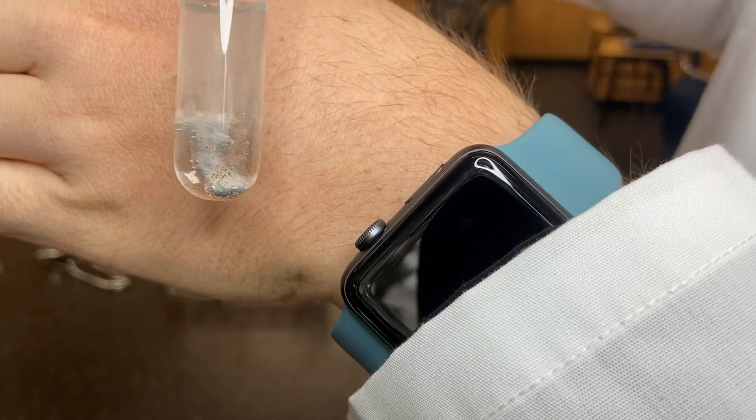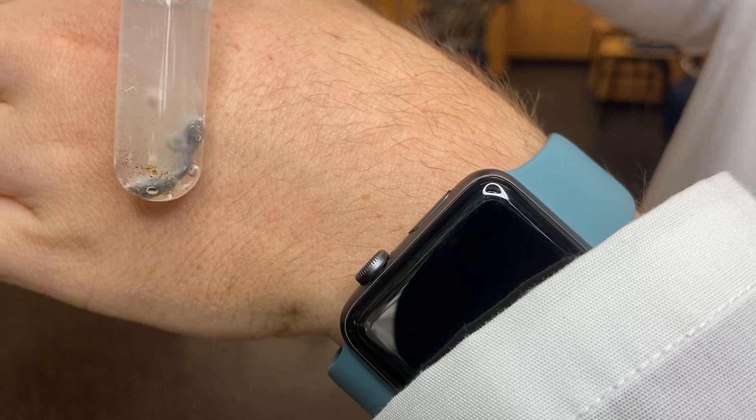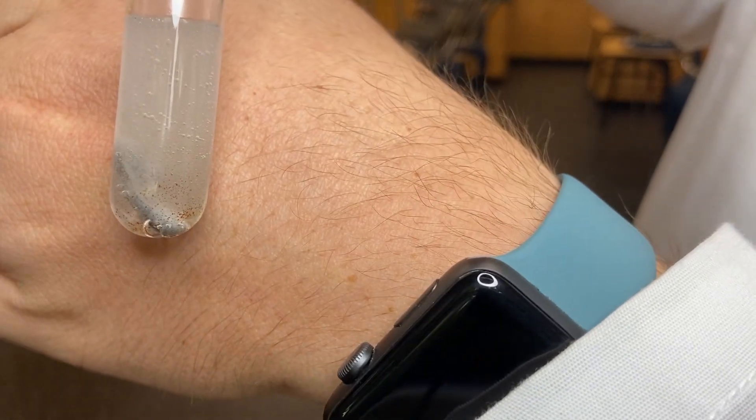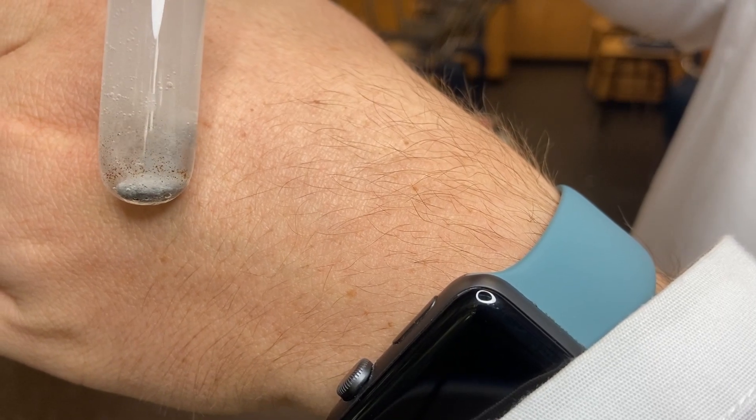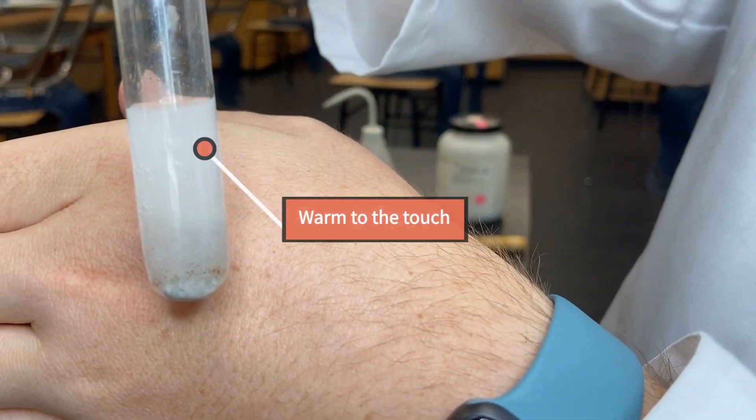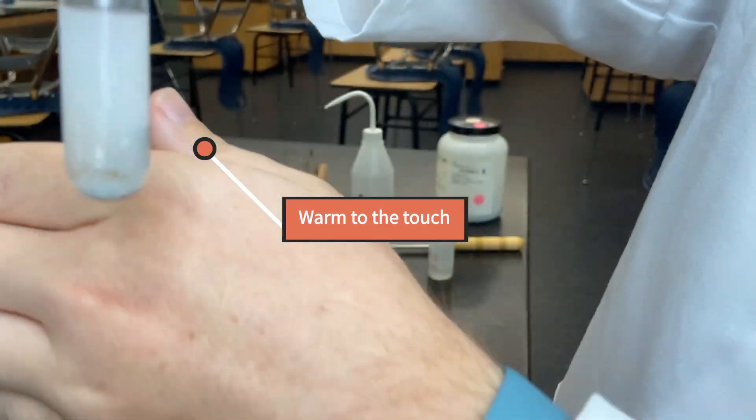We should know that this process is not sped up. This video clip is in real-time. Notice the distinct change in those two substances. This test tube is also warm to the touch.